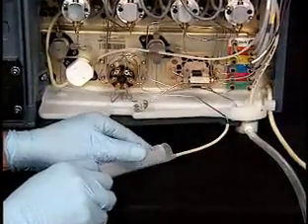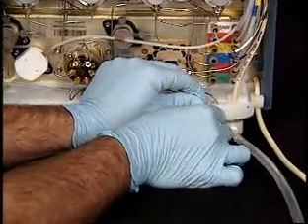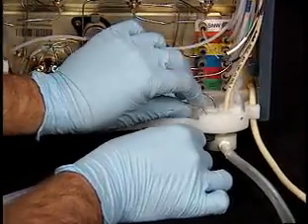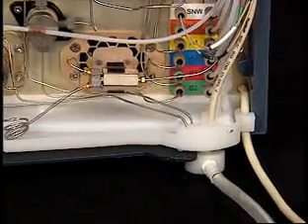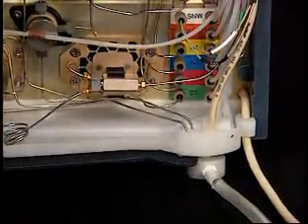Remove the syringe from the vent line and insert the vent line into the drip tray. Lastly, close the door of the Binary Solvent Manager.